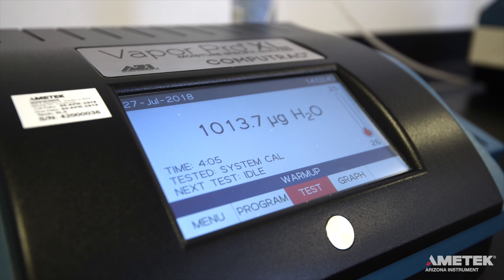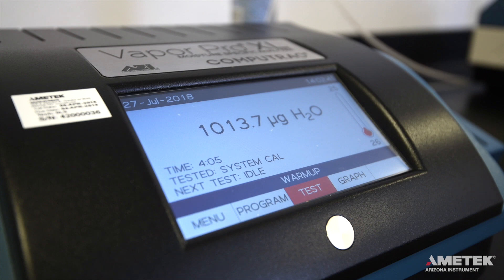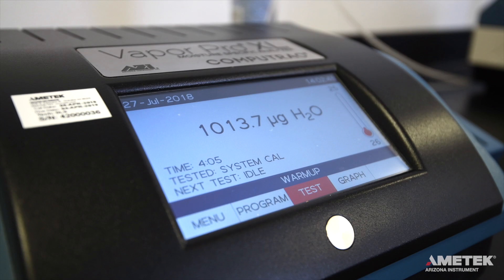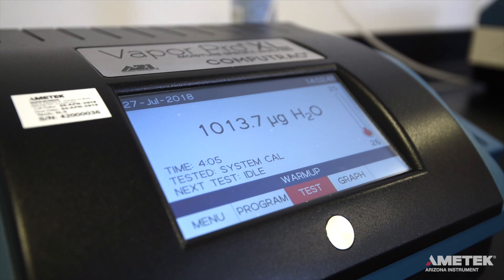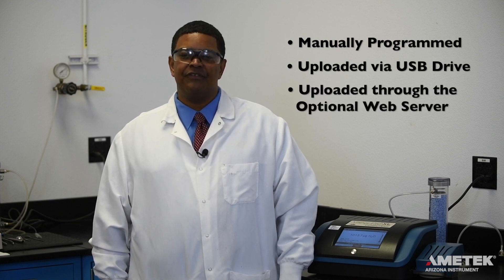The Vapor Pro XL can hold up to 250 test programs, three of which are factory programs. There are three ways in which test programs can be added to the instrument: they can be manually programmed on the instrument, uploaded via USB flash drive, or uploaded through the optional web server.